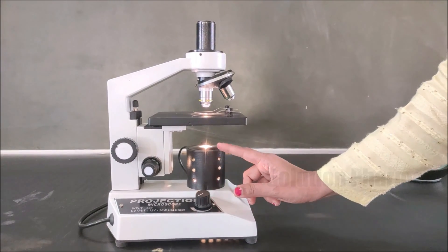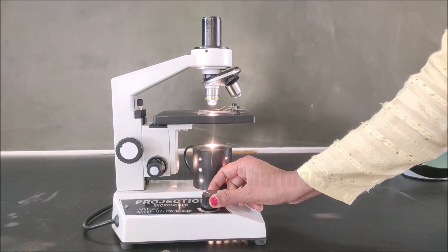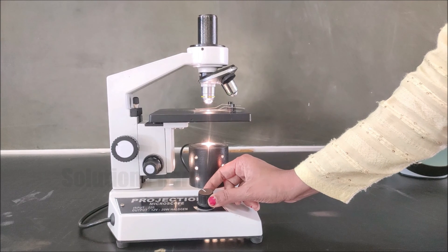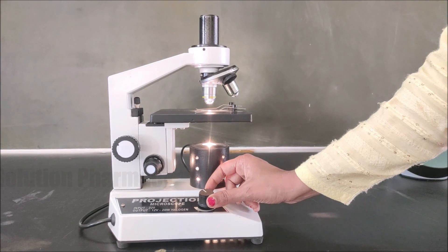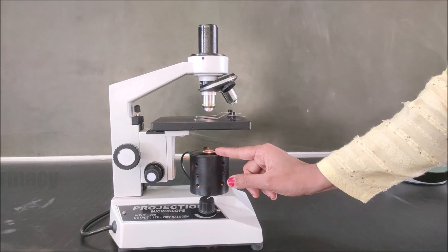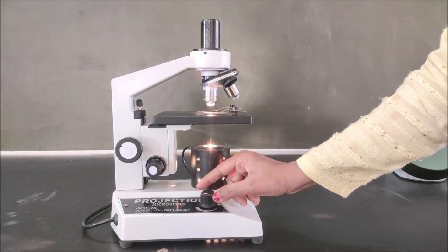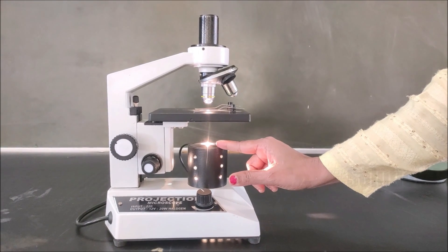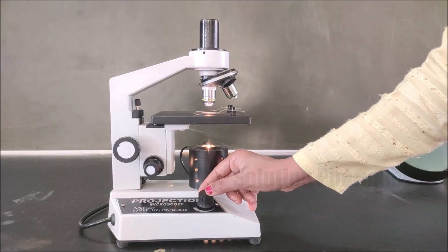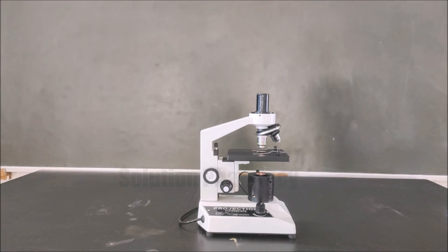The light adjusting knob controls the intensity of light. When we rotate the knob clockwise, the intensity of light increases to a maximum. When we rotate it anti-clockwise, the intensity of light decreases. In this way we adjust the amount of light which focuses from the aperture of the stage onto the specimen.